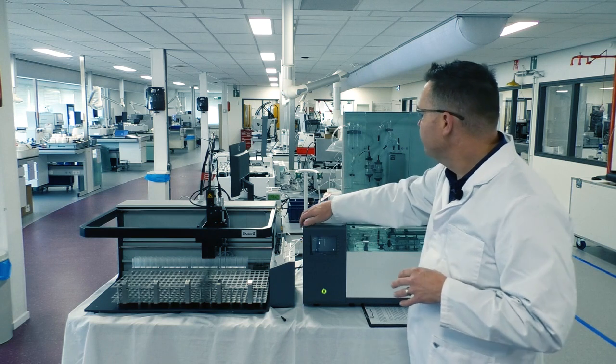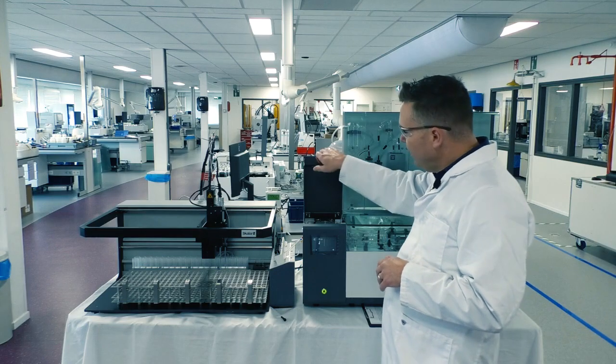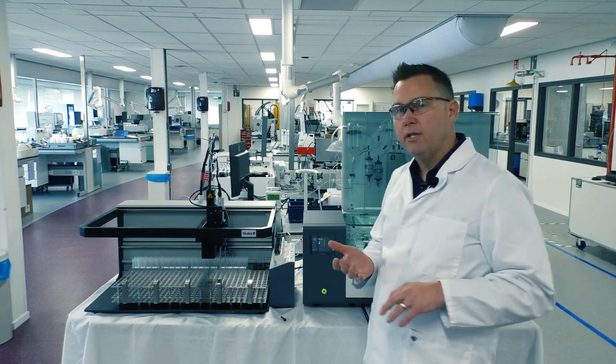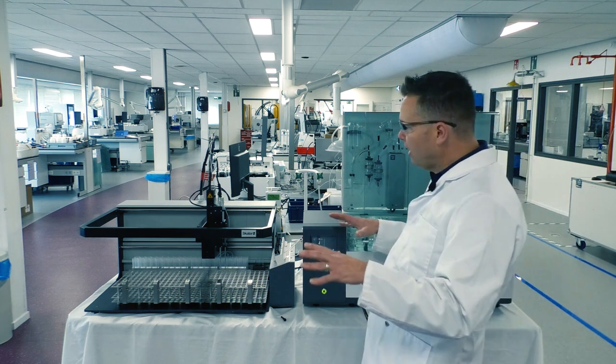It also does have the auto platen release. So once we've rinsed this out completely, we'll basically release the pressure on our pump tubes so that we're not wasting our pump tubes. And then from there, I also can control all of my external hardware, such as a UV lamp, my heaters, my detectors, gas flow if I'm running things that require gas. I'll turn all of that off and park it.